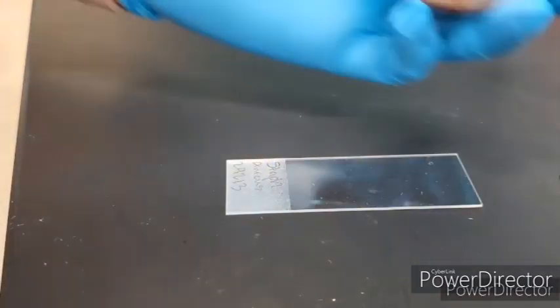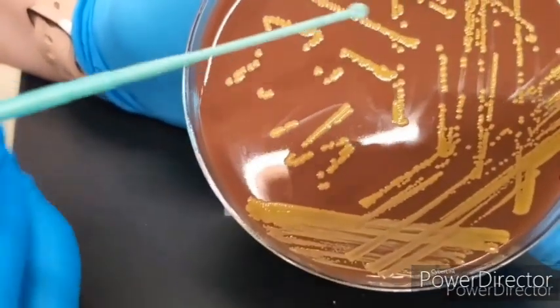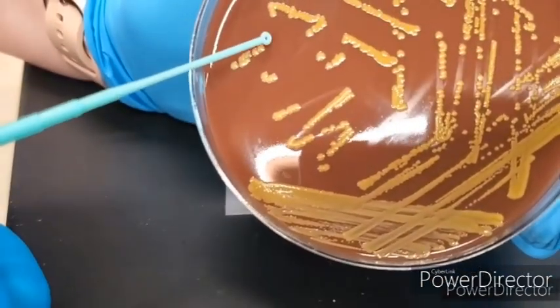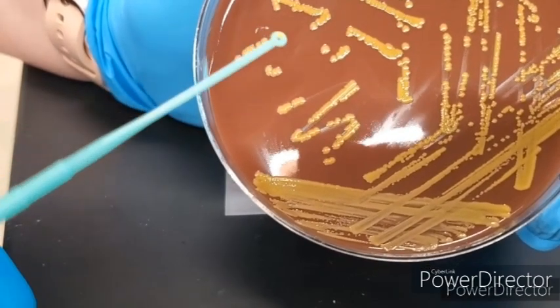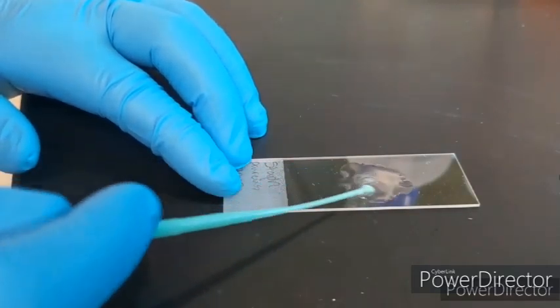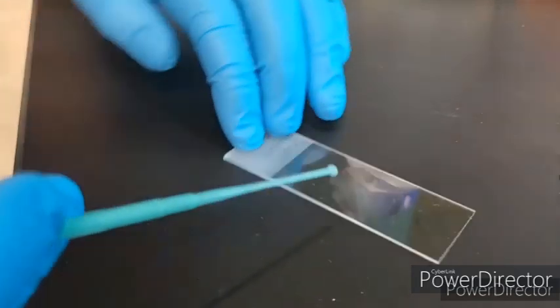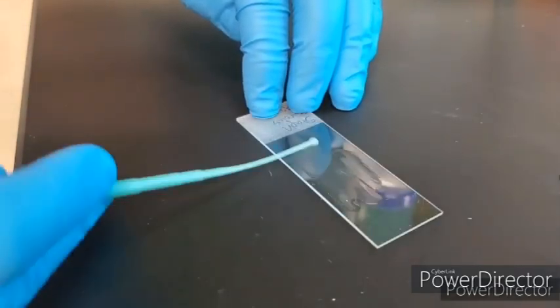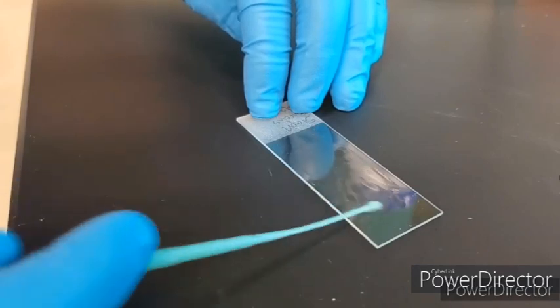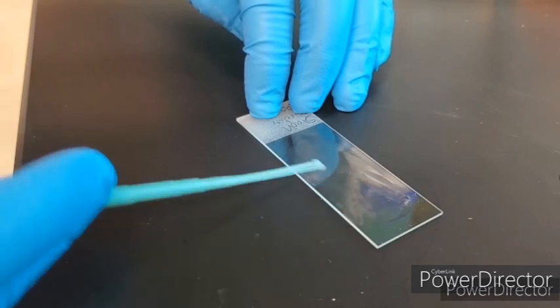So now we're going to do the staph, and we're going to do the same thing. I'm going to try to show you how I pick my colony. That one looks pretty isolated, so I'm just going to take a little bit. It's actually kind of a lot because staph goes a long way. So mixing it, spreading it out, because we don't want it too thick, or otherwise we can't see very well because it picks up too much of the stain.